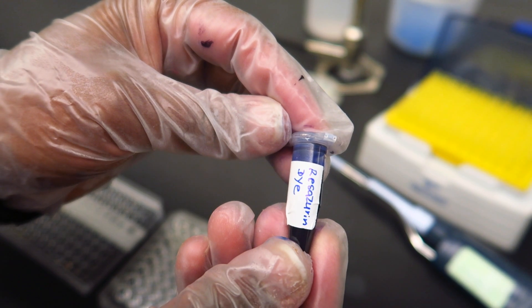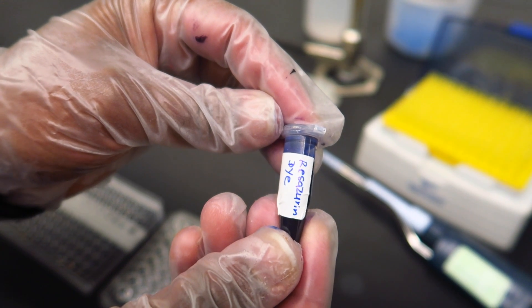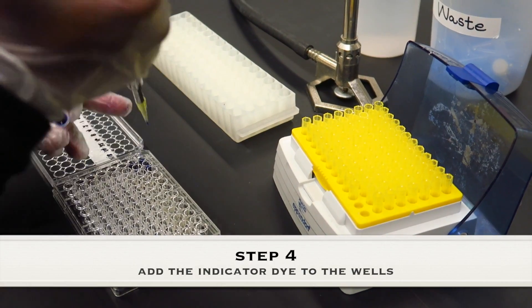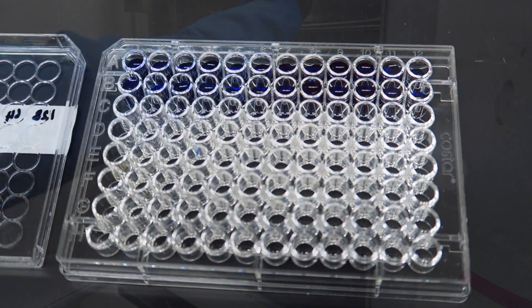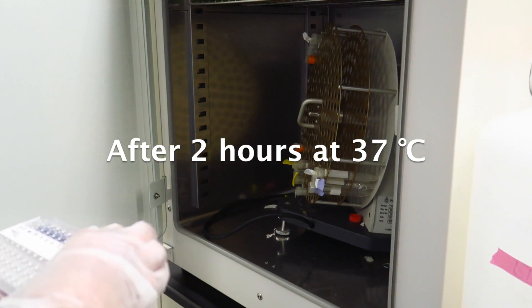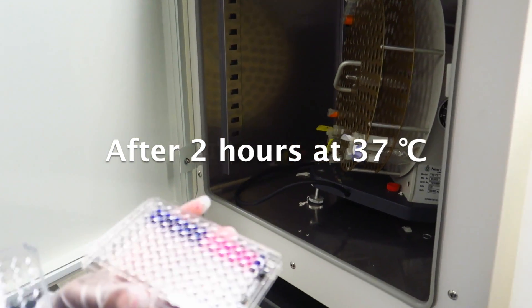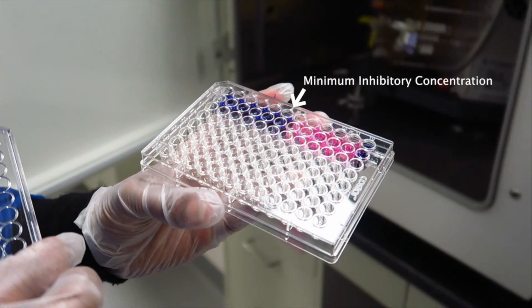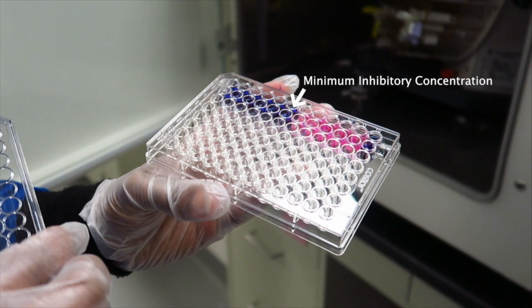To distinguish between live and dead bacteria, we use an indicator dye called resazurin. Pink color represents live bacteria, and blue represents dead bacteria.